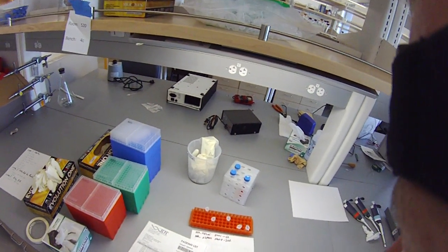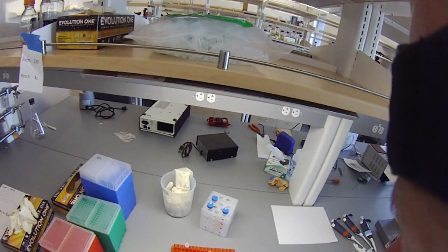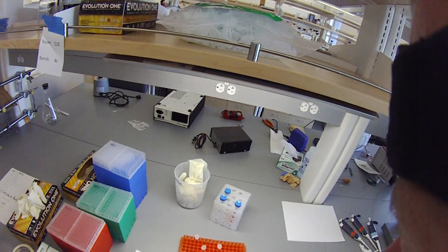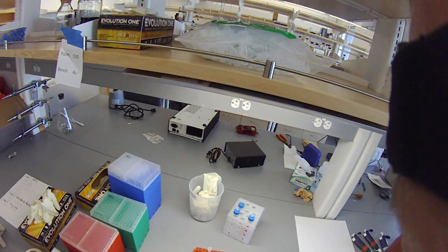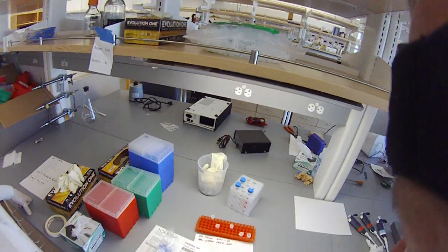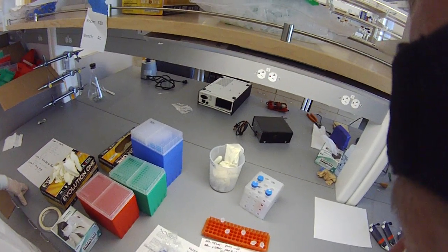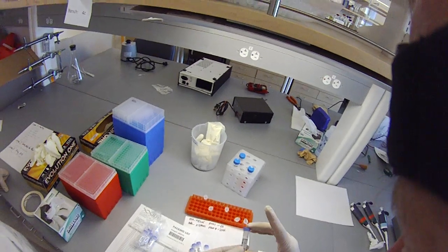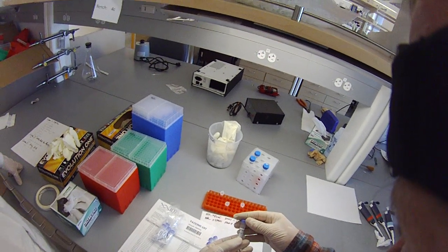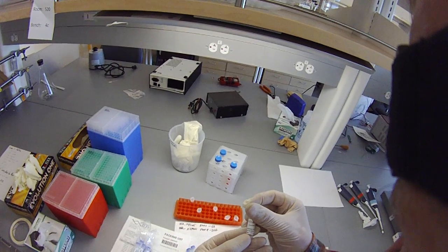Let's open up one of these bags and take a look at what we've got inside. We've got a bunch of tubes here. We're going to resuspend all these oligos to 100 micromolar with just plain water. The way we determine how much water to add is based on the numbers on the side of the tube. They've got a lot of numbers here.